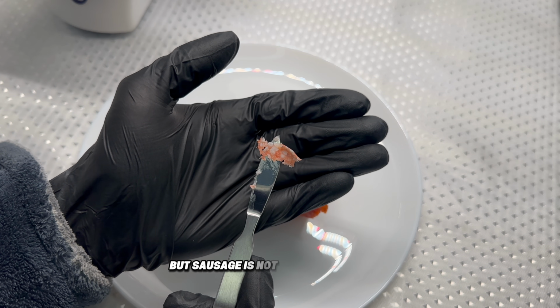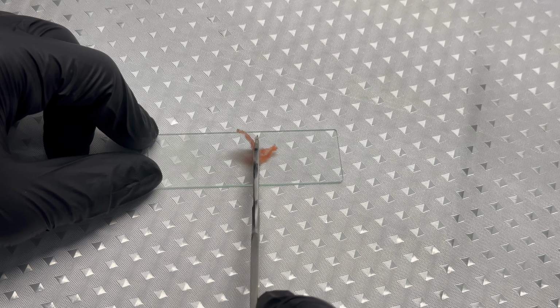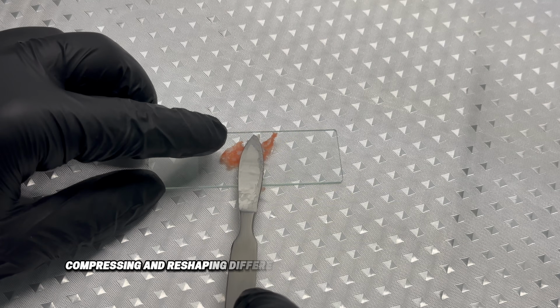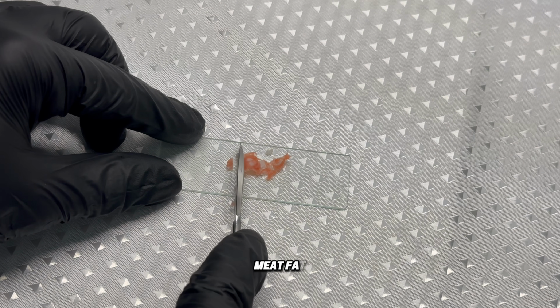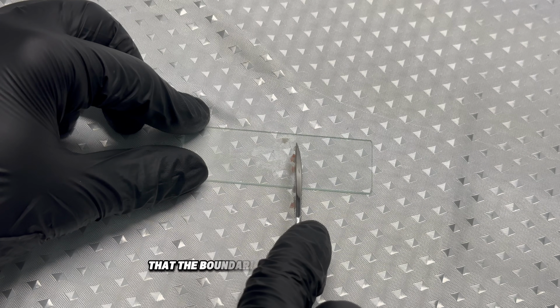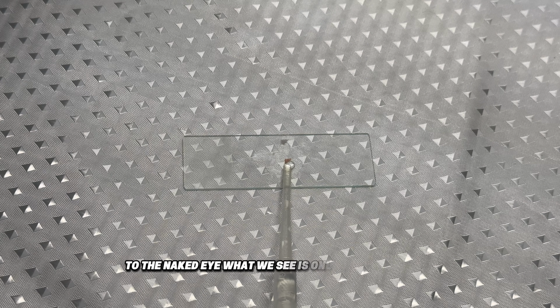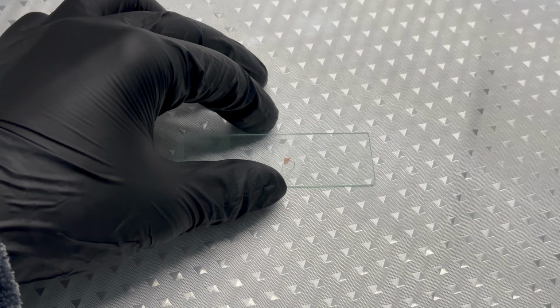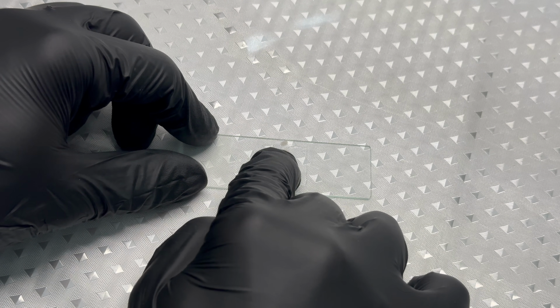But sausage is not a single substance. It is created by grinding, mixing, compressing, and reshaping different components into one compact form. Meat, fat, and various additives are combined so tightly that the boundaries between them disappear to the naked eye. What we see is only the final result. The real structure is hidden inside.